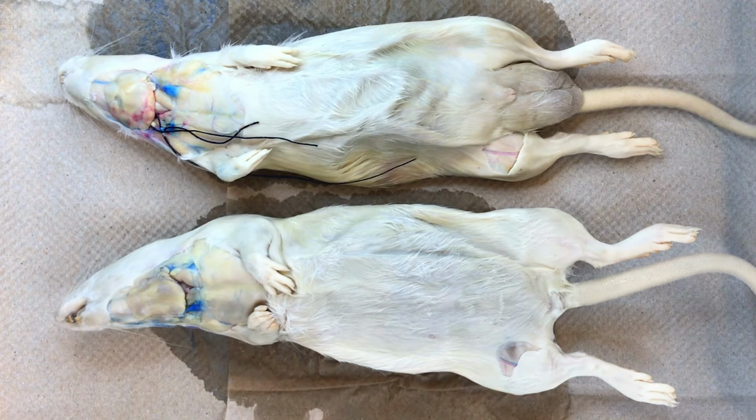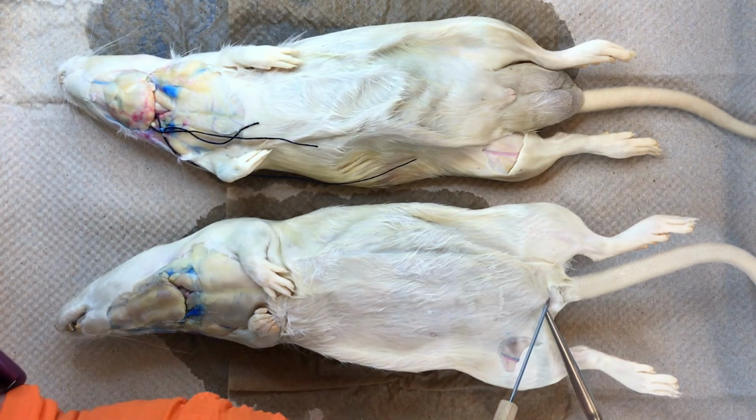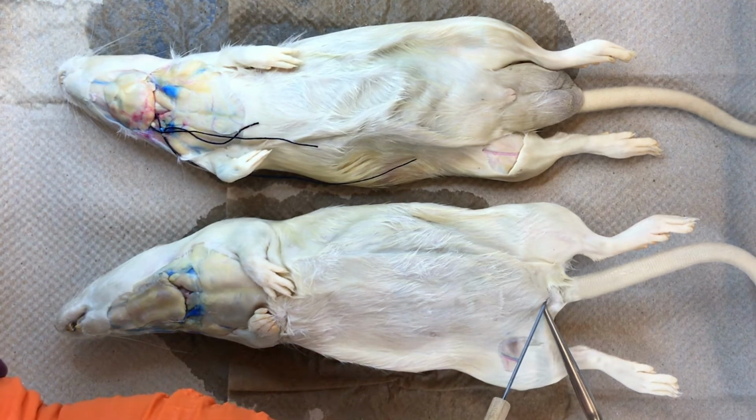The female has 3 openings: the anus, the vagina in front of the anus, and the urinary opening. They can be differentiated here.